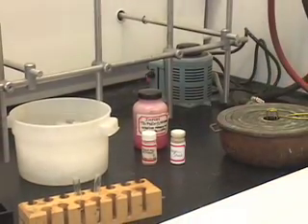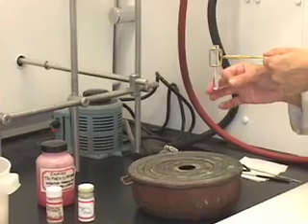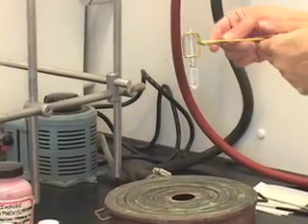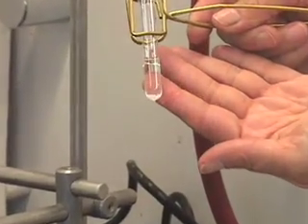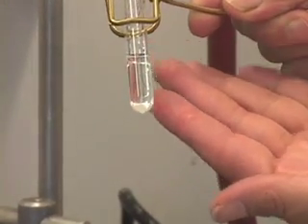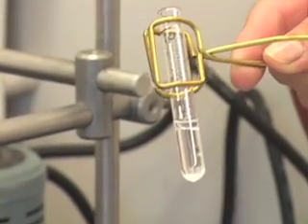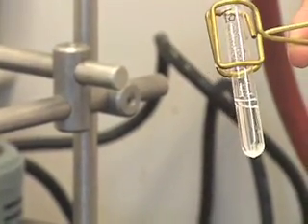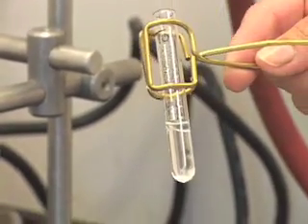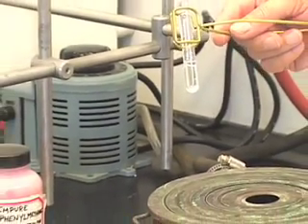In the meantime, again let us take this tube out and see what happened. You notice that there is solid still left. So, the compound did not dissolve in toluene either at room temperature or when we heated it in the steam bath. Since it is insoluble in toluene at both temperatures, we can eliminate toluene as a good solvent.